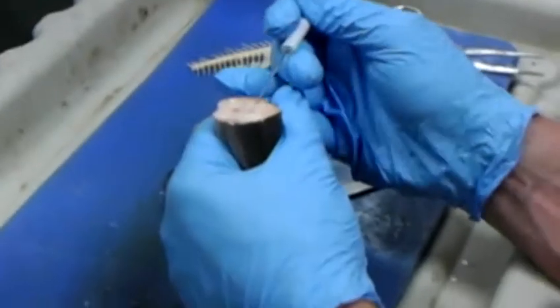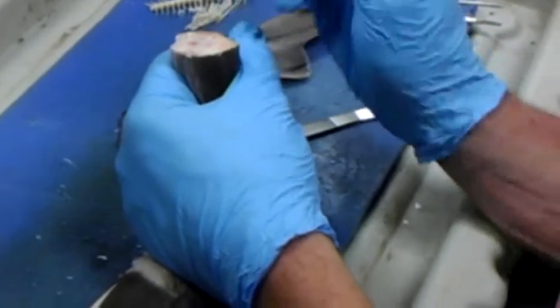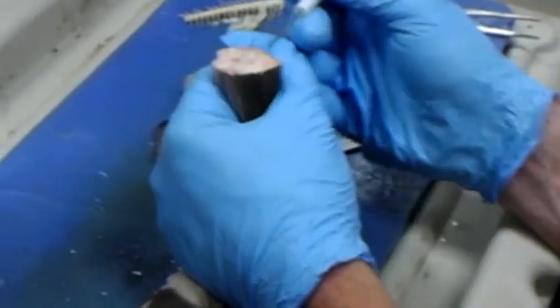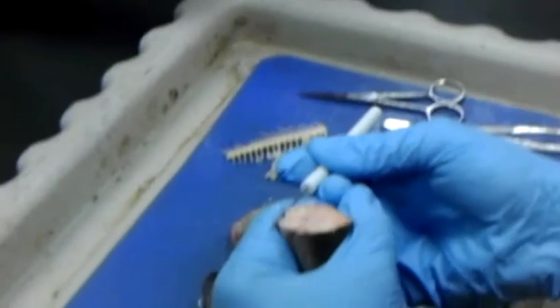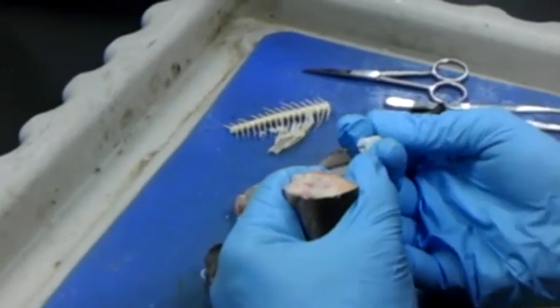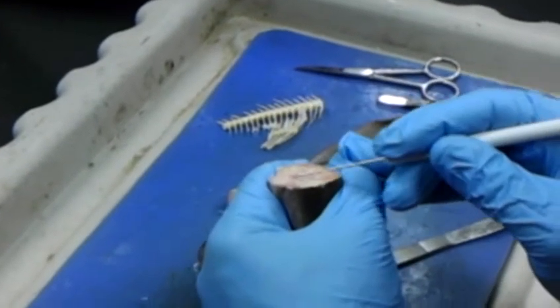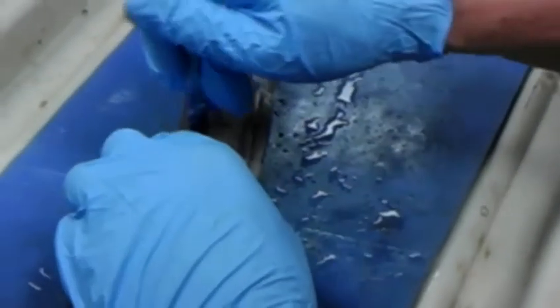Whereas the white muscle group still has blood going to it, but not as much. This is where it stores up energy, and then it can explode, but it quickly fatigues. So that's the difference between white and red muscles. So hypaxial groups, this is embryology, denoting the different groups. Then you have, based upon function, red versus white. And then you will have another way to look at these, and these are in segments.